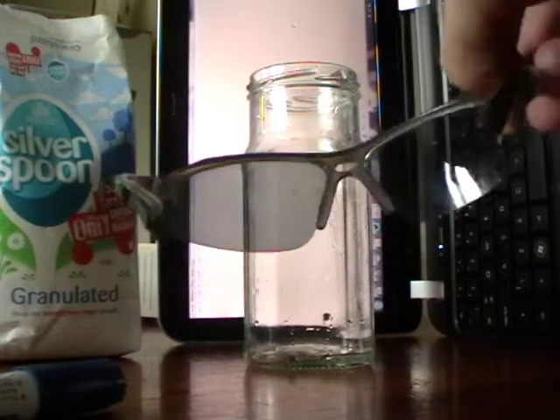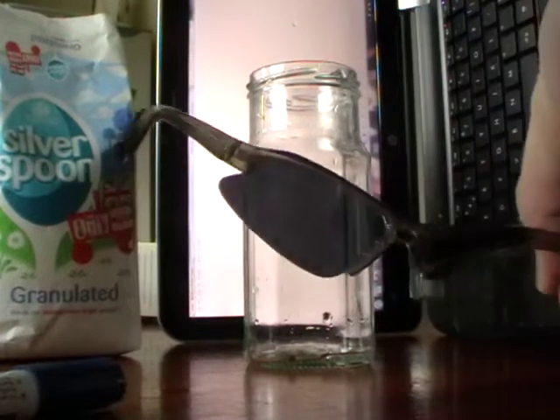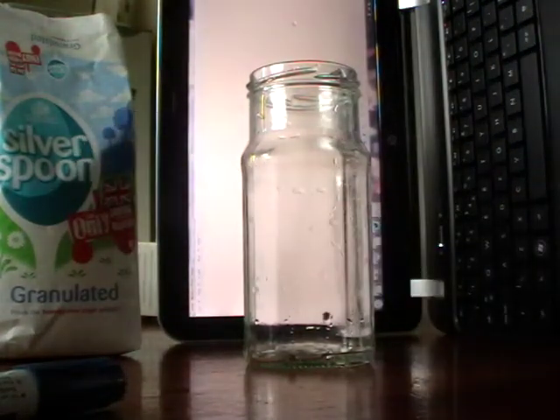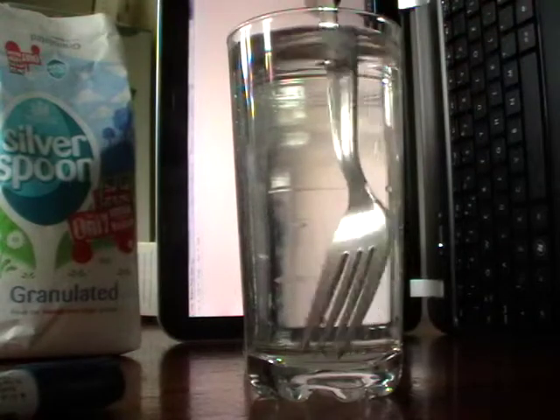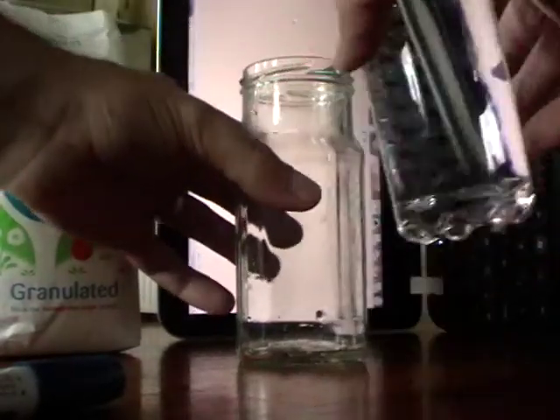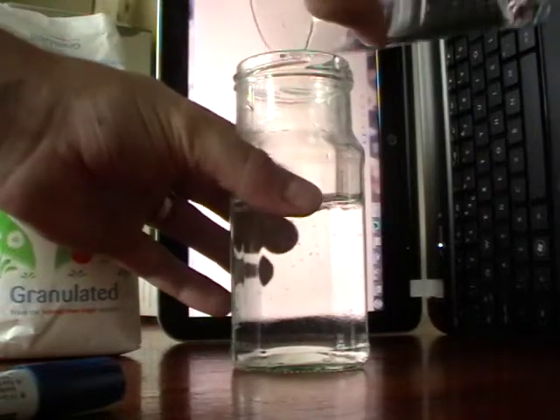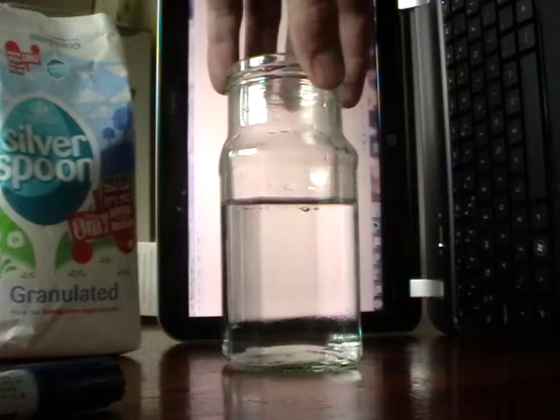You can see if I rotate these in front of the screen, you can see the effect they have blocking out the plane polarised light from the flat screen. I've got two solutions: a solution of warm tap water saturated with sugar, and some ordinary water. I'm going to use the ordinary water first and pour it into my square jar — though you could totally do it in a glass, it worked brilliantly.